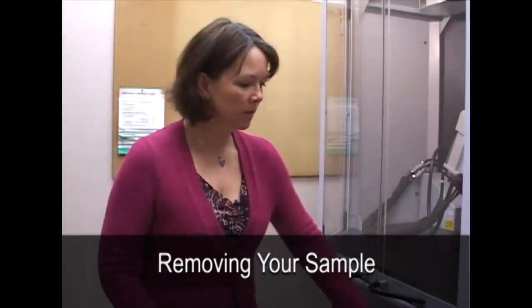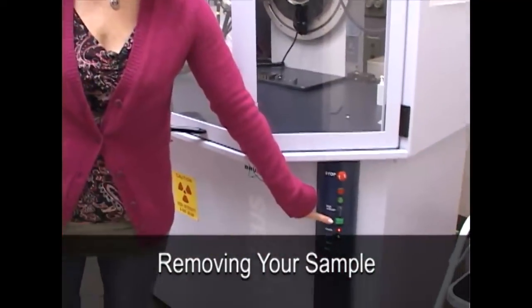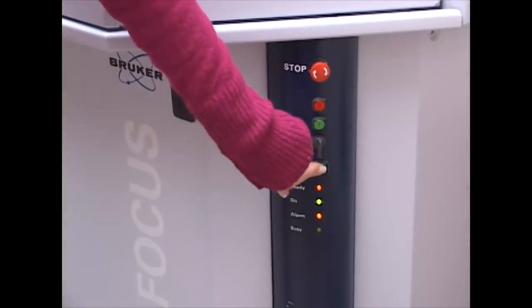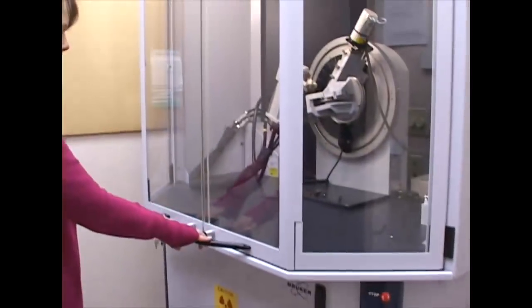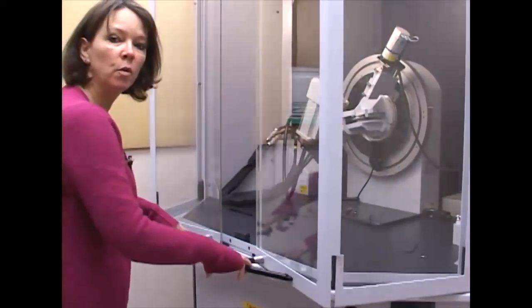So to open the door, there's a big square open door button here. It's the only button you ever want to push. Press it. The alarm light starts to flash. Pull the handles out towards you and away.